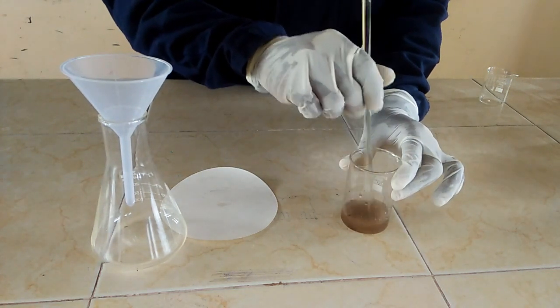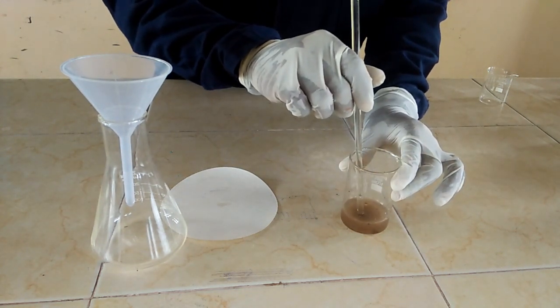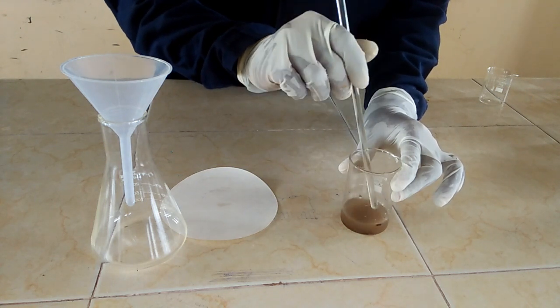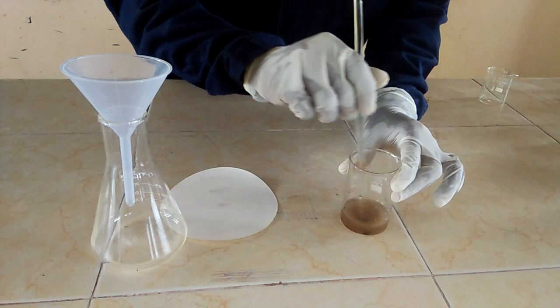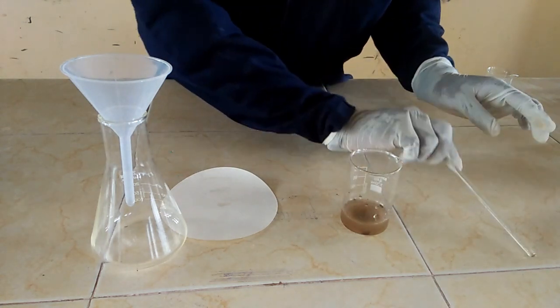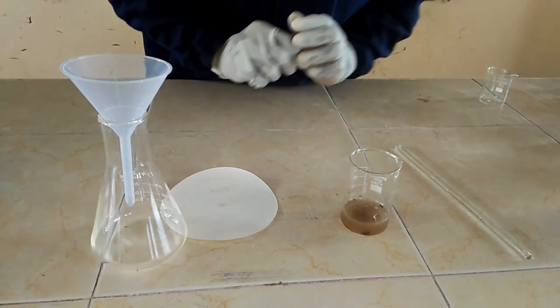With me I have a mixture of soil and water. The water is dirty, it has suspended particles. The soil is not soluble in water.